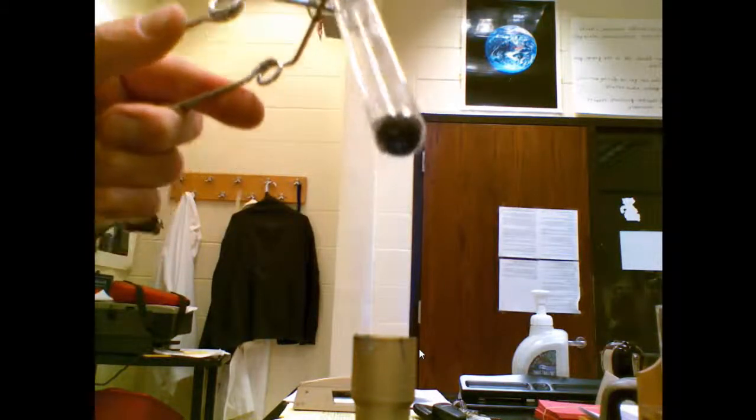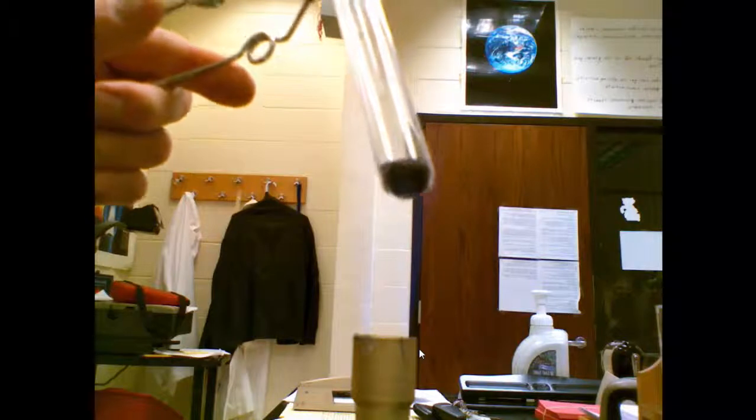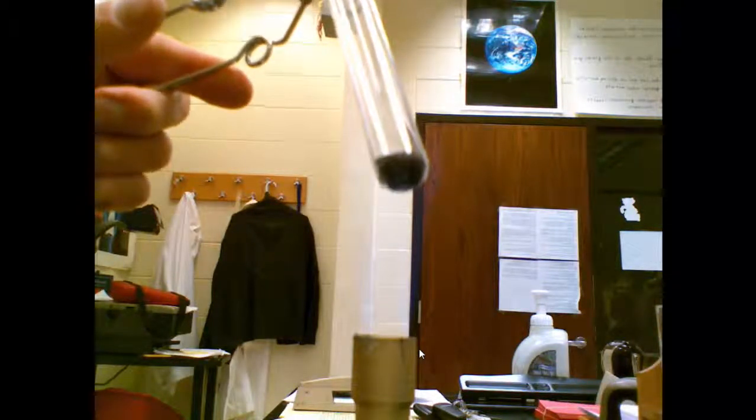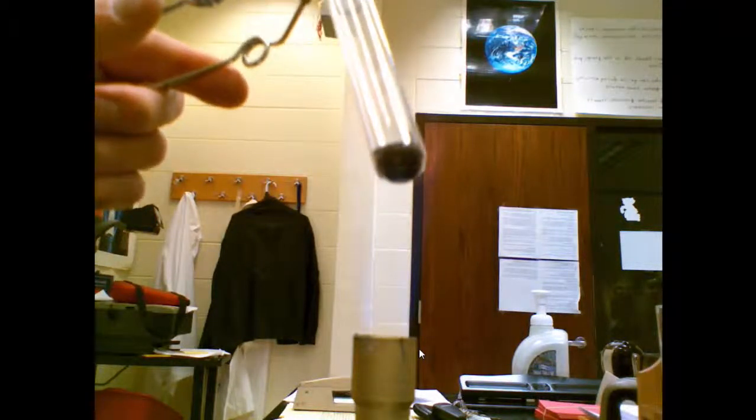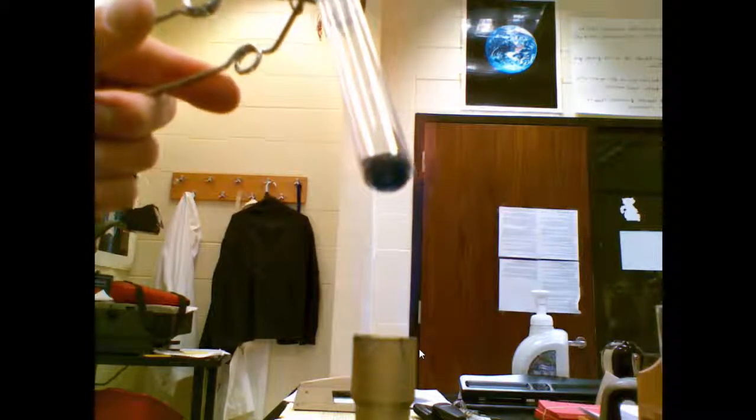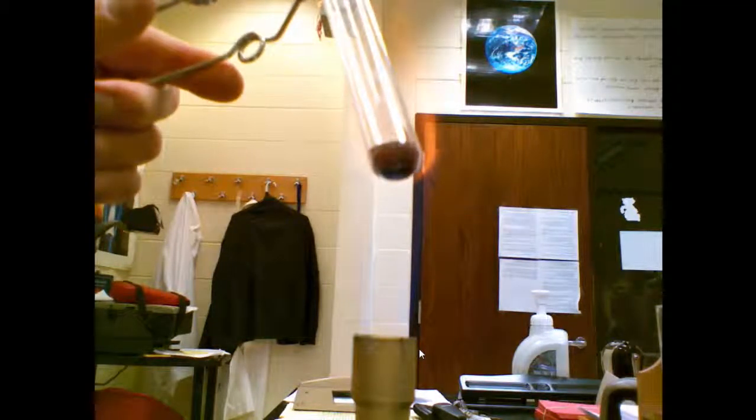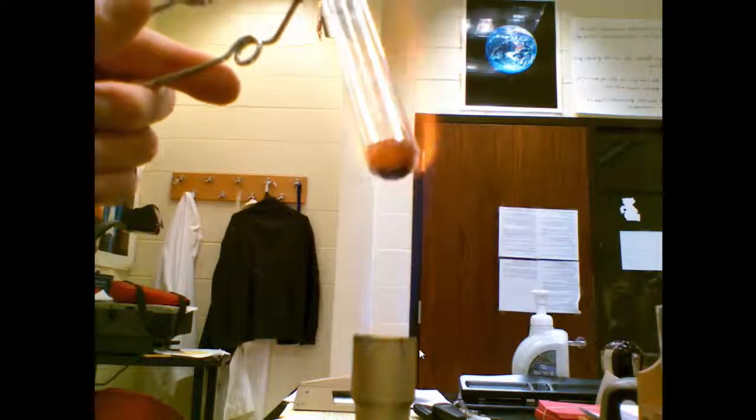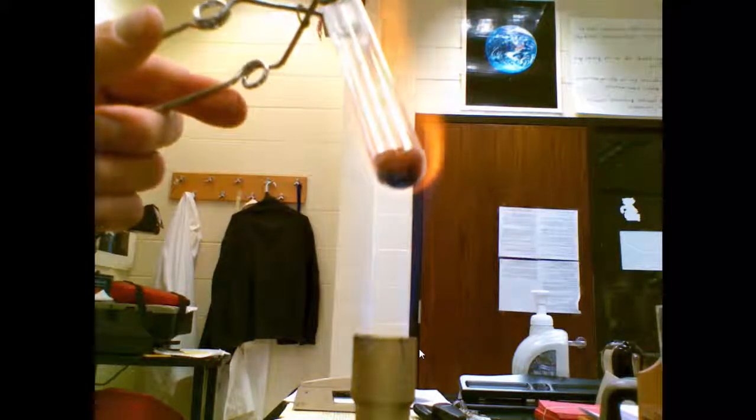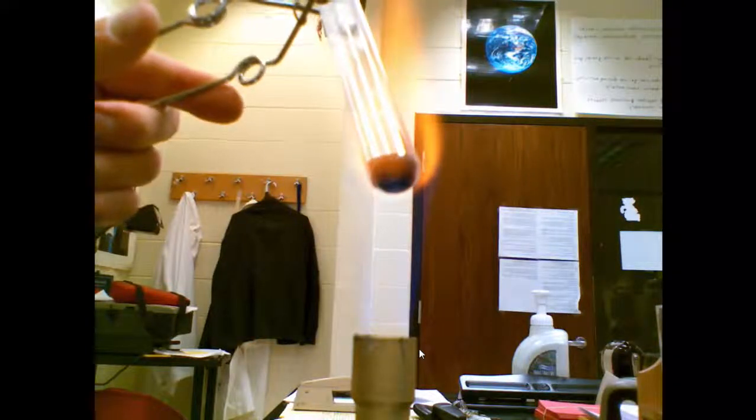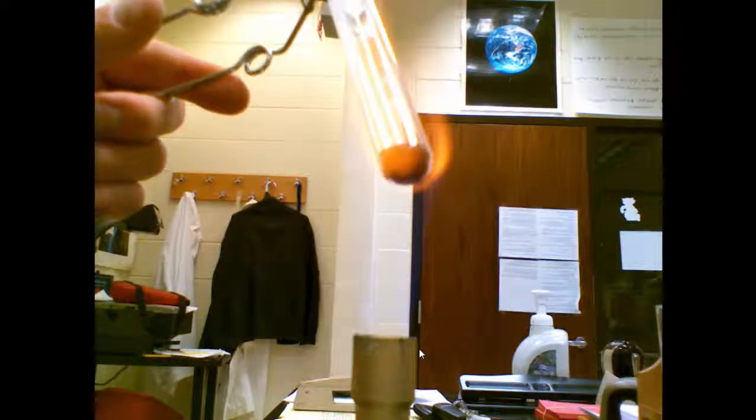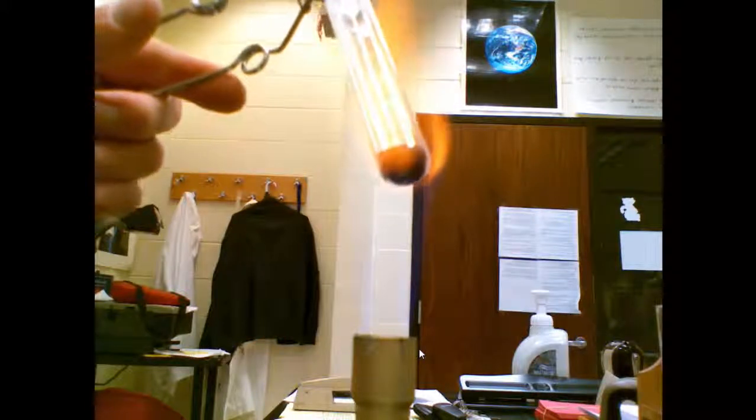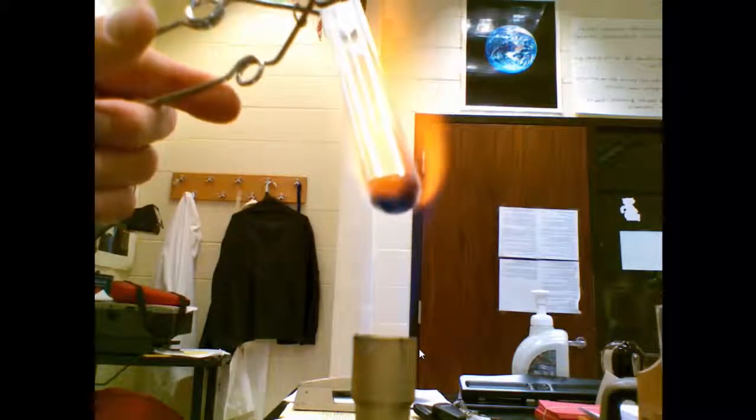And finally, this is crystal number 12. This is a brownish filing. The flame is beginning to turn yellow. No sign of melting yet. This flame definitely turned yellow with no melting. We were not able to melt crystal 12 in our Bunsen burner.